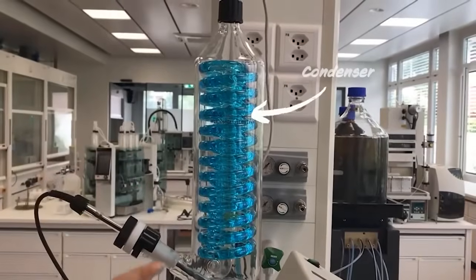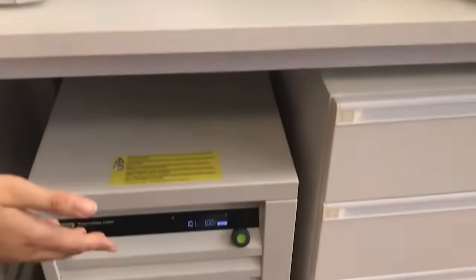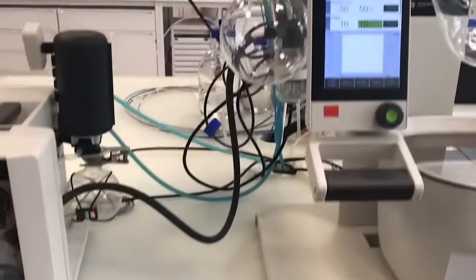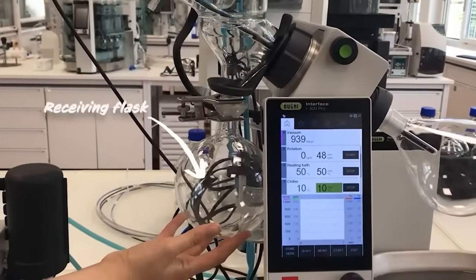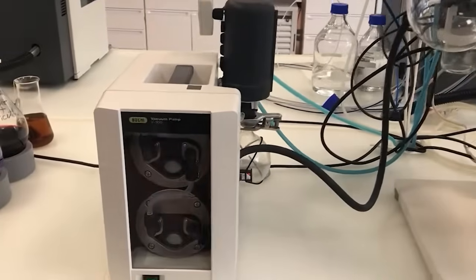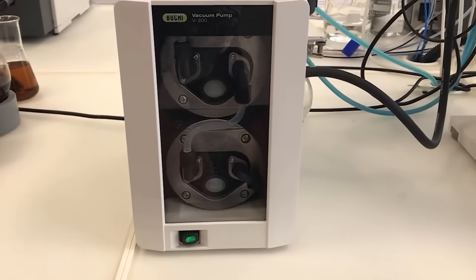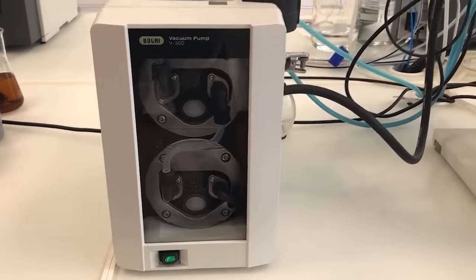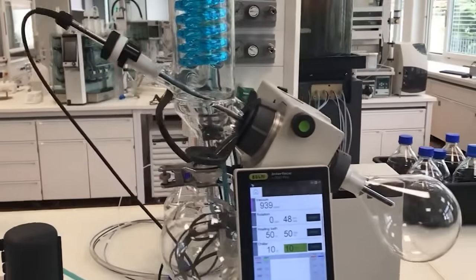Upon reaching the lowered boiling point, the vapor will then travel through the vapor duct into the condensation area. This area is cooled by a chiller or by means of tap water, and the distillate will be collected into the receiving flask. To reduce the pressure inside the system, one needs a vacuum source — here we have a vacuum pump that allows evaporation at a reduced boiling point and pulls the vapor into the condensation area.